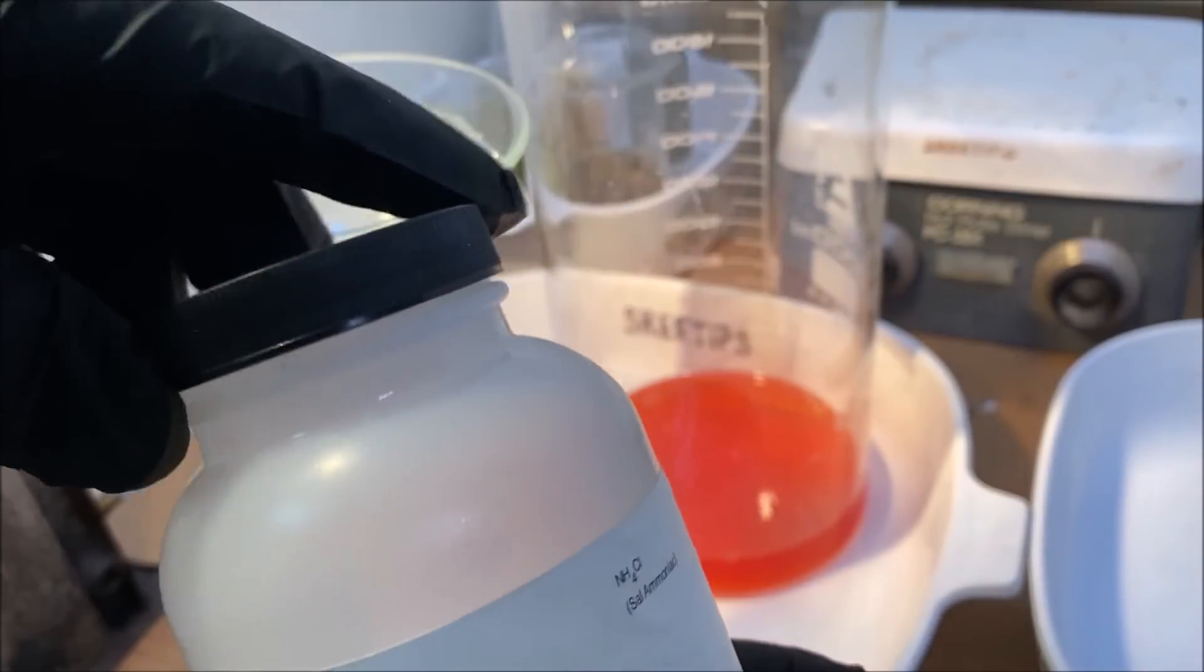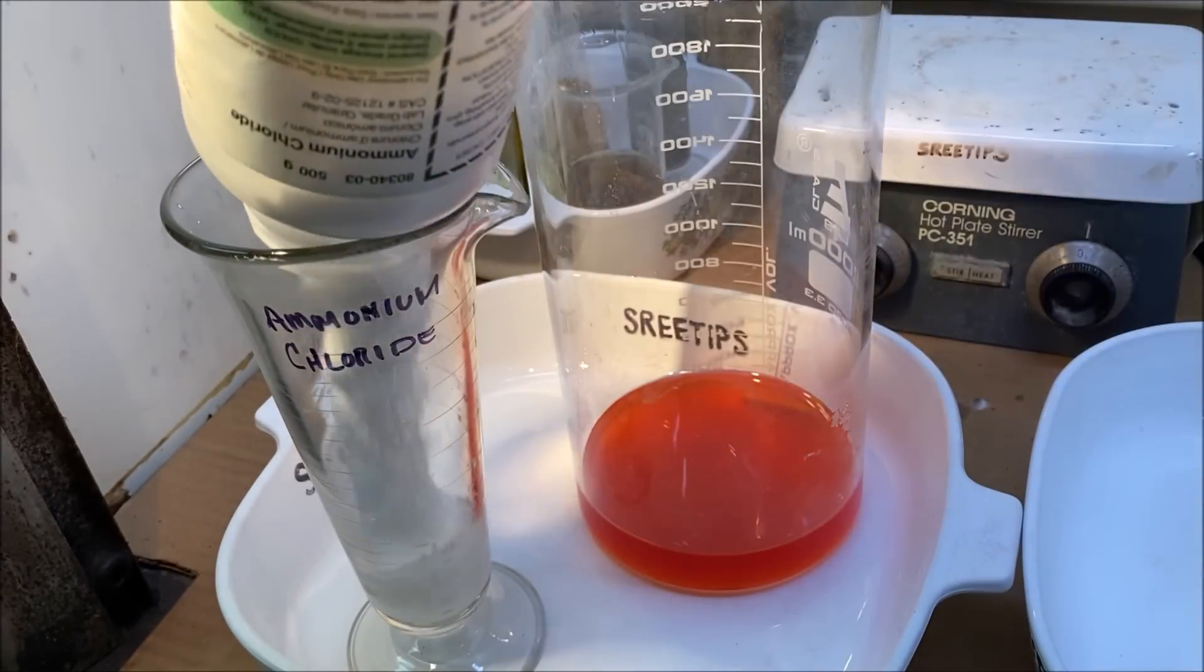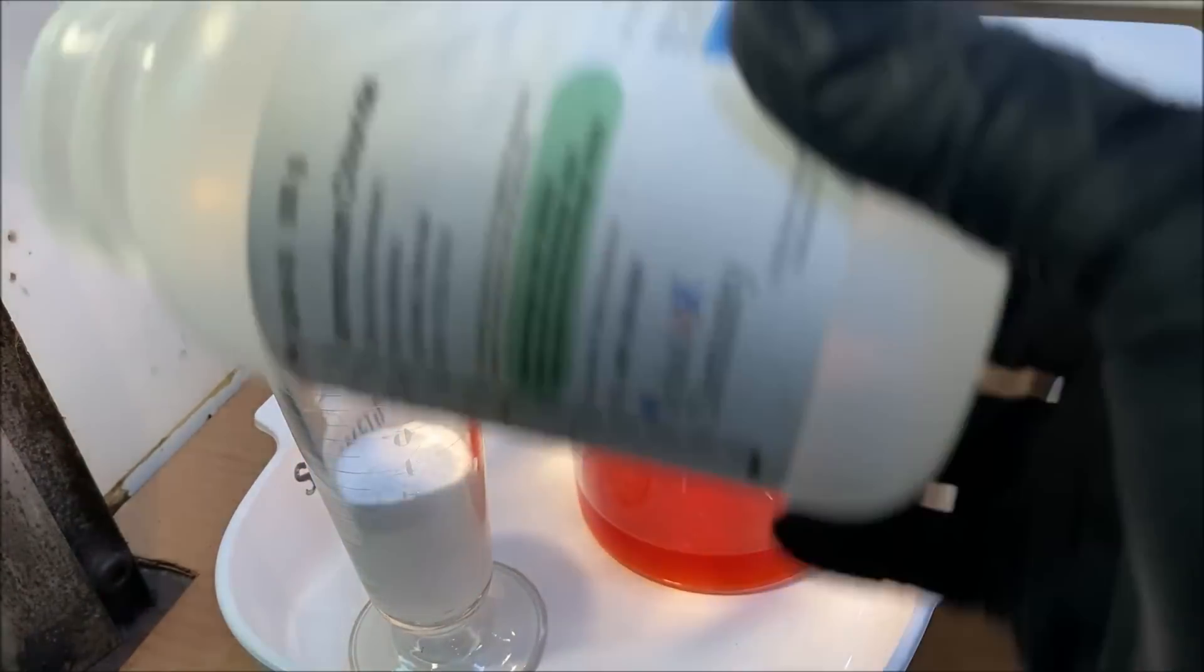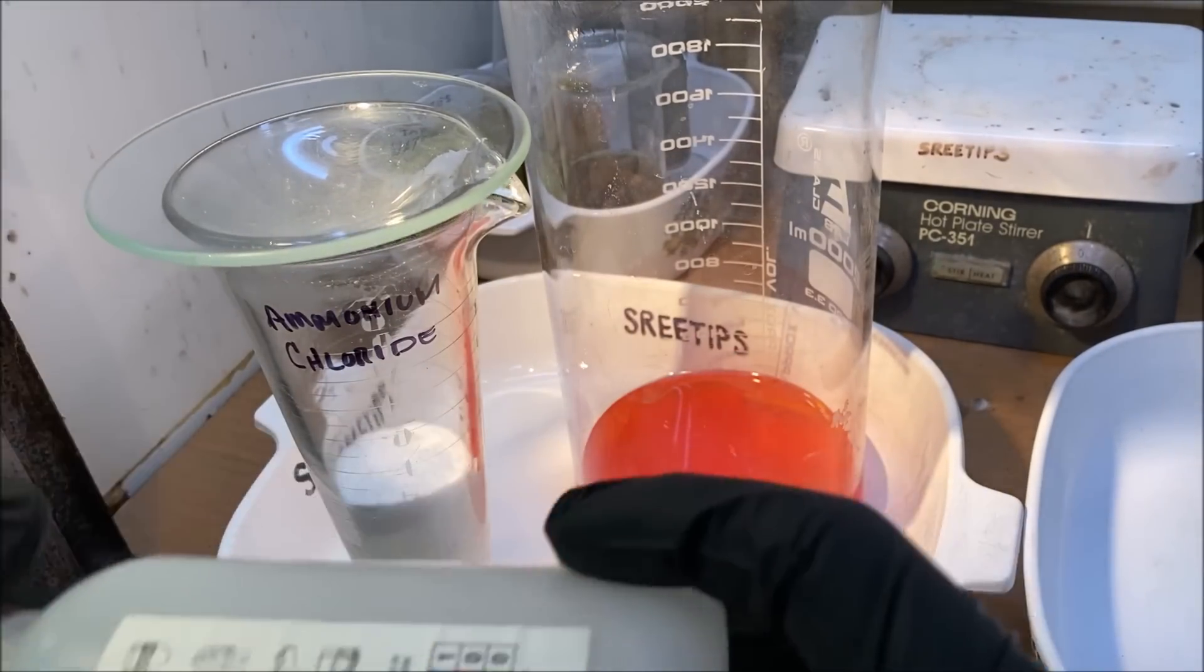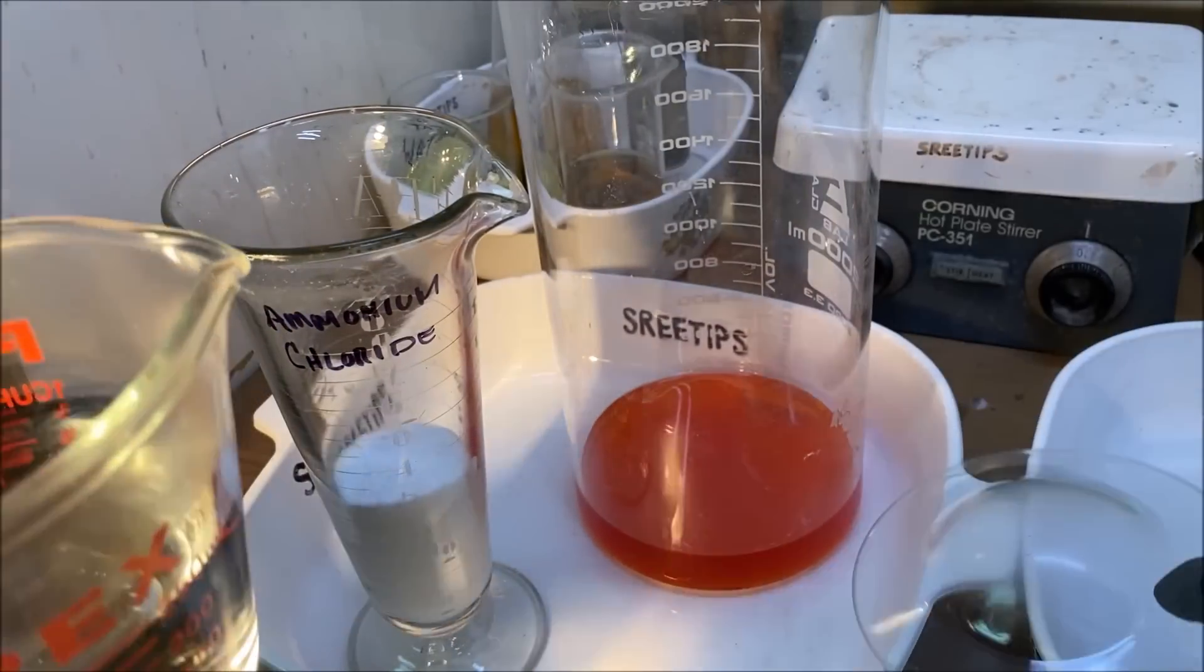I'm going to make some ammonium chloride. I've got some warm distilled water.